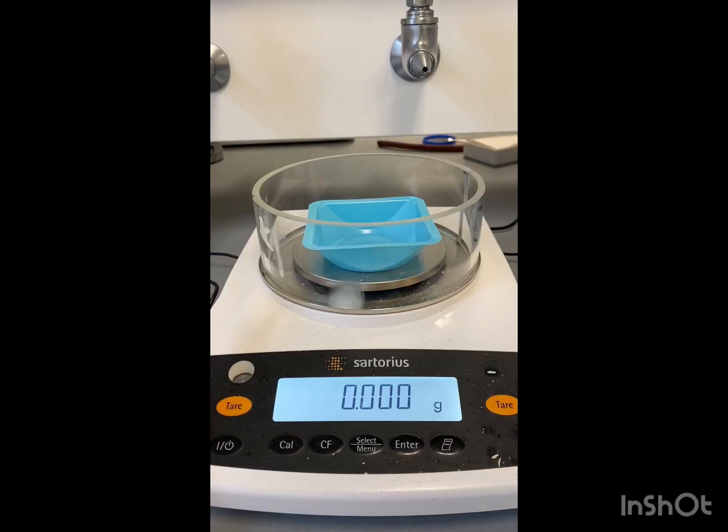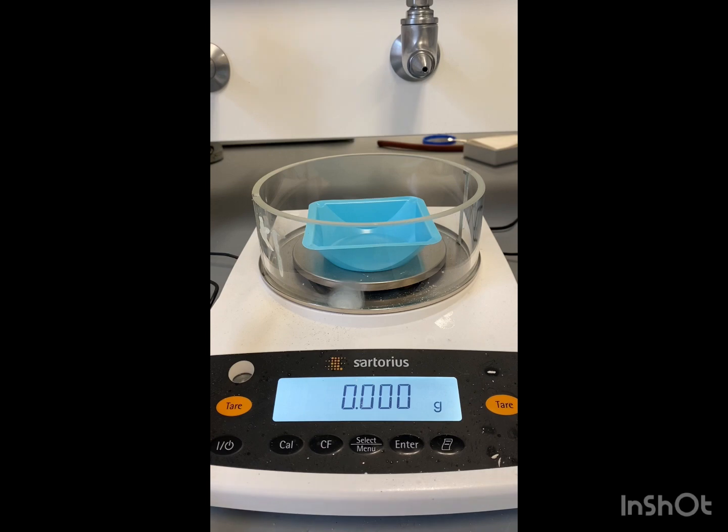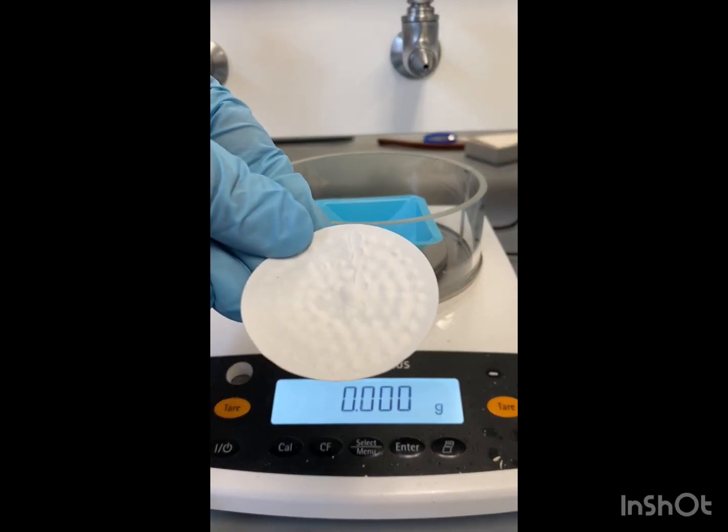All right, now that our solution has crystallized, we're going to transfer it and get a final mass. So this is what our final product looks like.